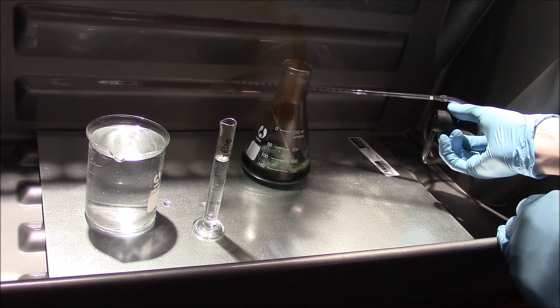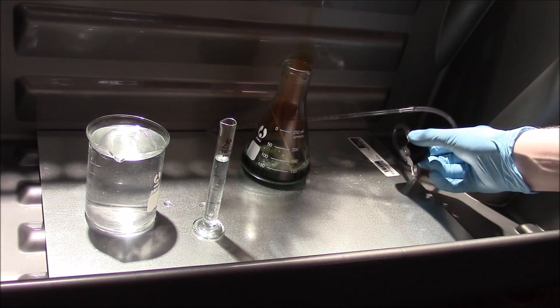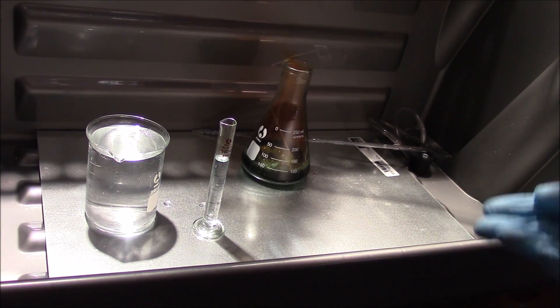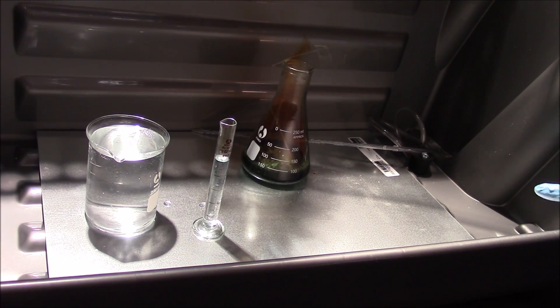You can see all that gas going right out our vent — let that all come right out. We had a little bit of pressure in there and it's all coming out now.